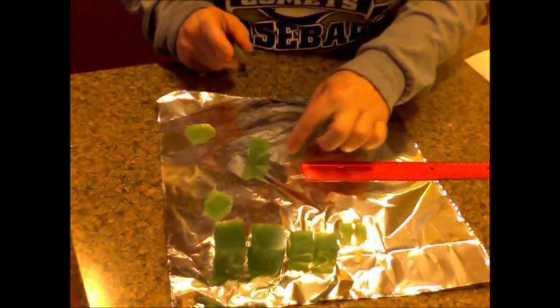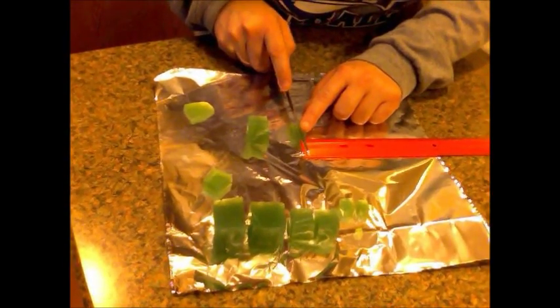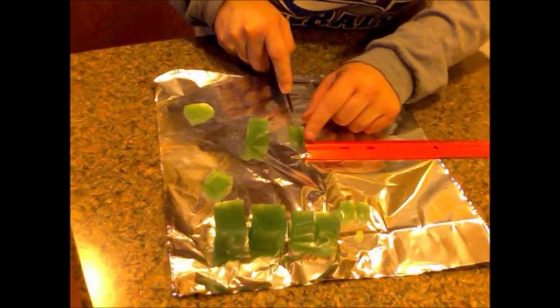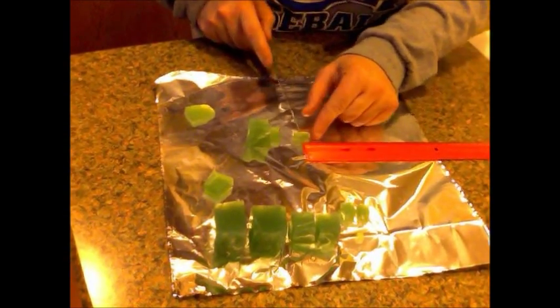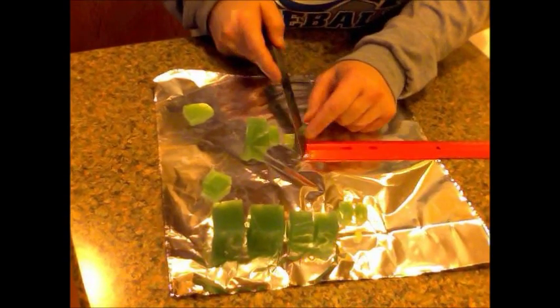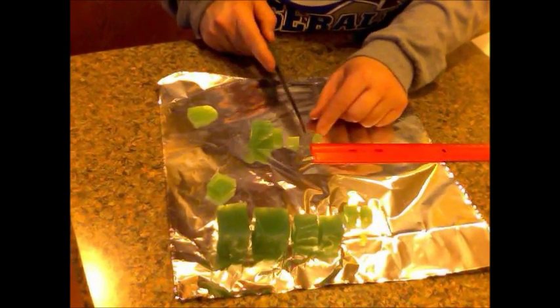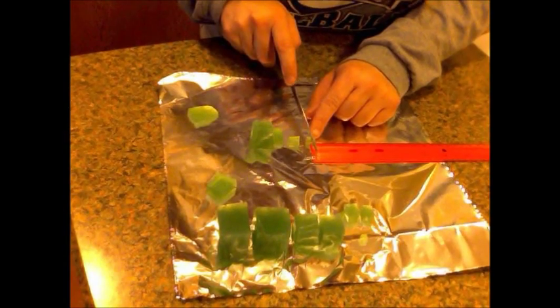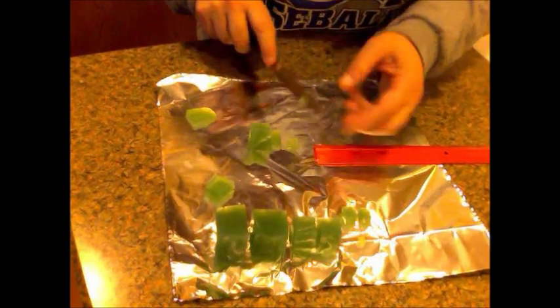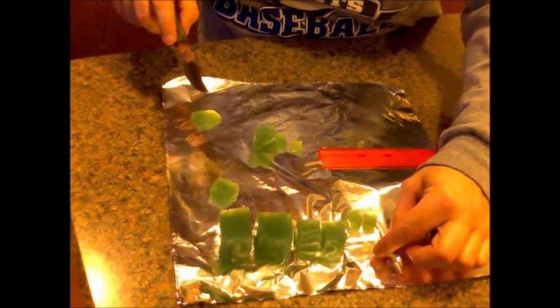Take your last little small chunk and cut it in half. This time it's five millimeters, or one half of a centimeter on all sides. This one's tiny — be careful with them. You'll have some leftover, that's okay, but from one block you should end up with four different sized blocks.